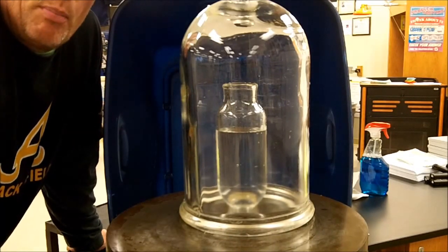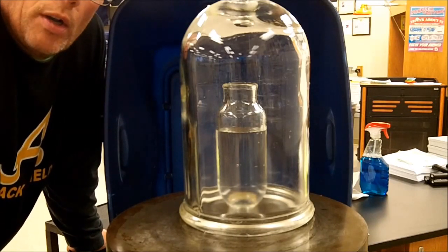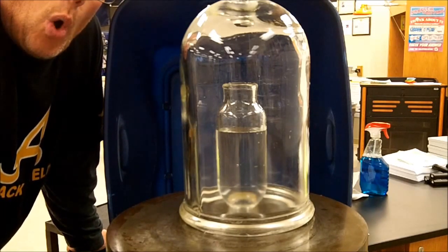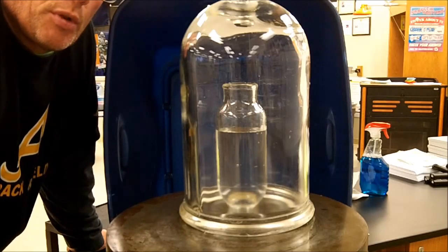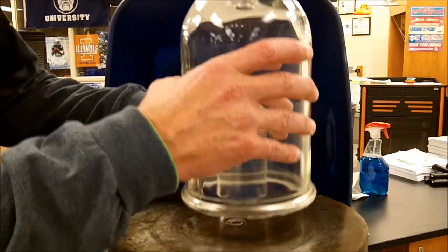And here's my prediction. As the water begins to boil at room temperature for the water, the water will actually get colder or cooler. So the temperature will drop for the water as it's boiling. All right. So let me go ahead and do a couple things here.